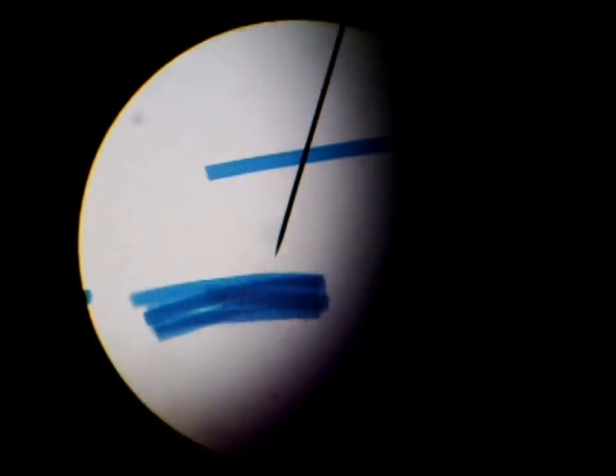This is Oscillatoria. It's domain bacteria and it's a type of cyanobacteria, and it's photosynthetic.